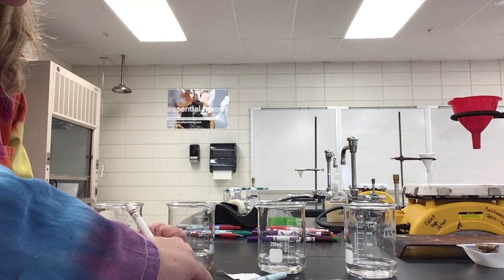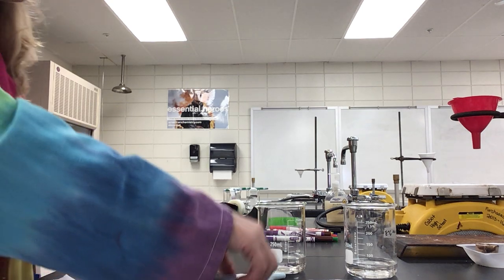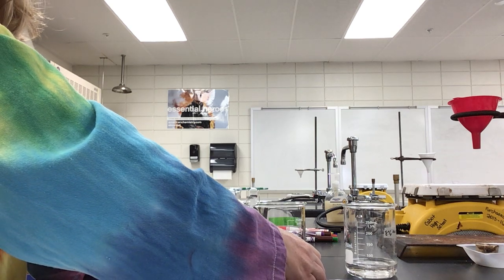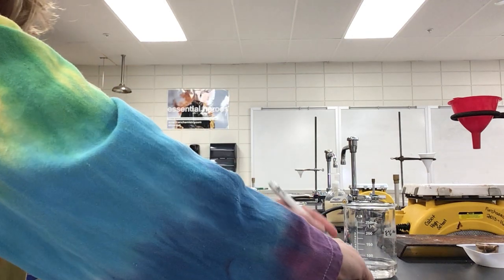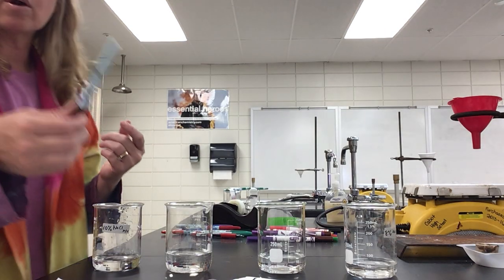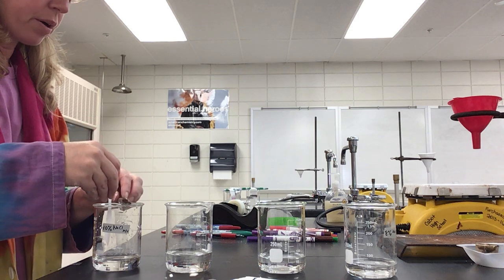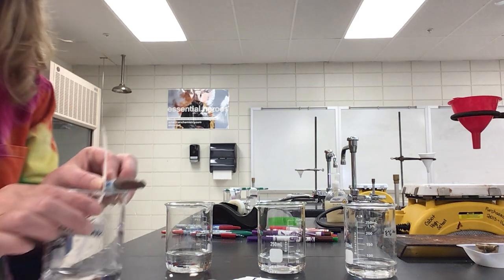Every one of your papers, and use a different marker. So now we're going to use Crayola brown. Then we're going to do our black, okay? All right, mark all of your papers first, and then you're going to take it and you're going to tape it. And you can just use the marker that you use to write on, and make sure when you put it in here, I'm going to show you guys.